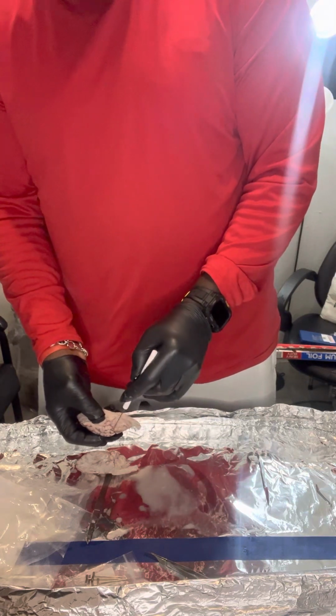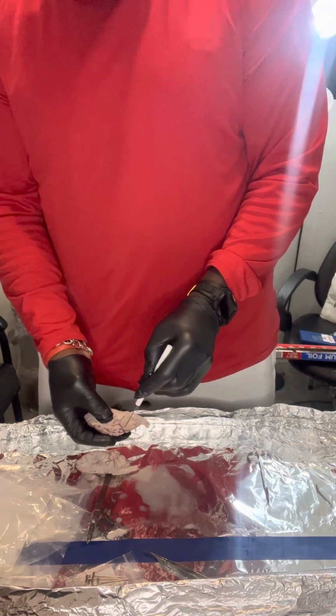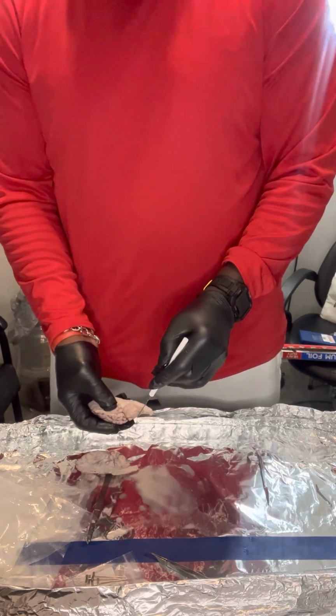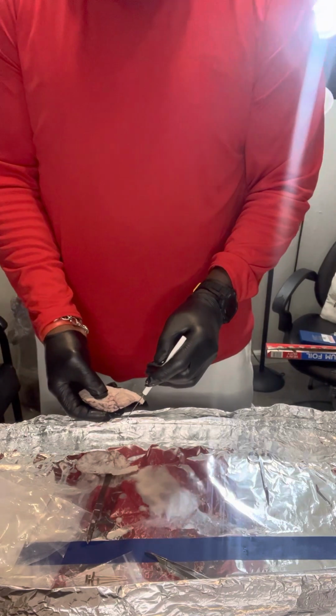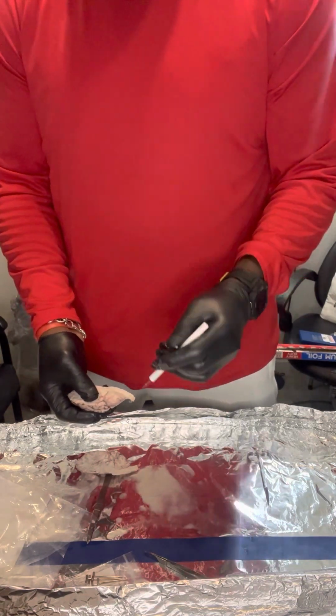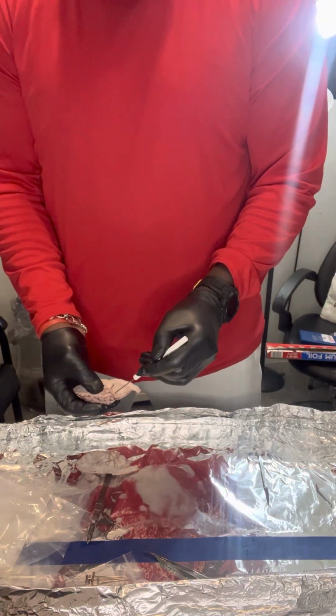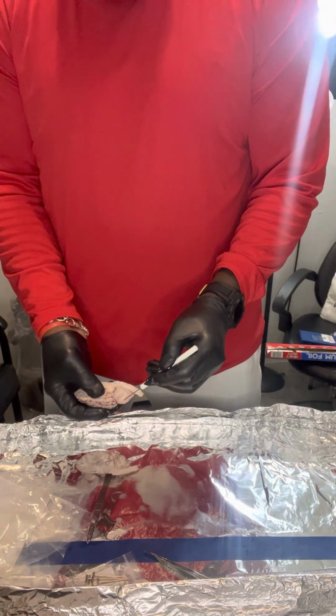All of this right here. Some identify this as the mini brain, the little brain in the big brain. Regulates a wide range of functions and processes in both the brain and the body. So this guy is very important. This again is the cerebellum.